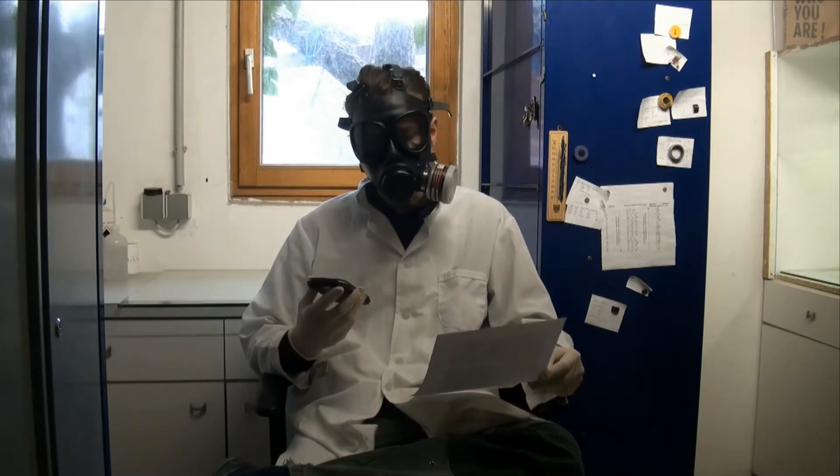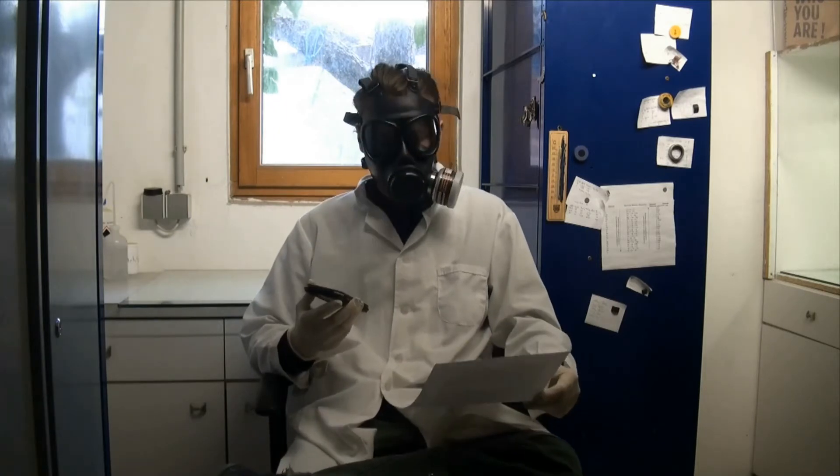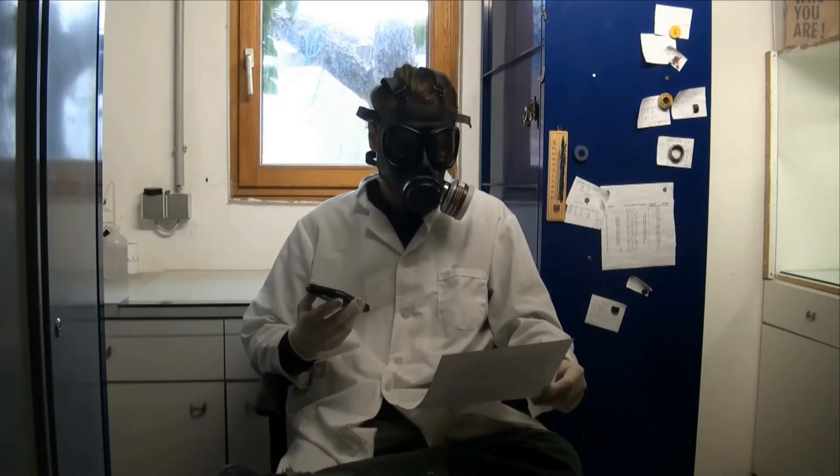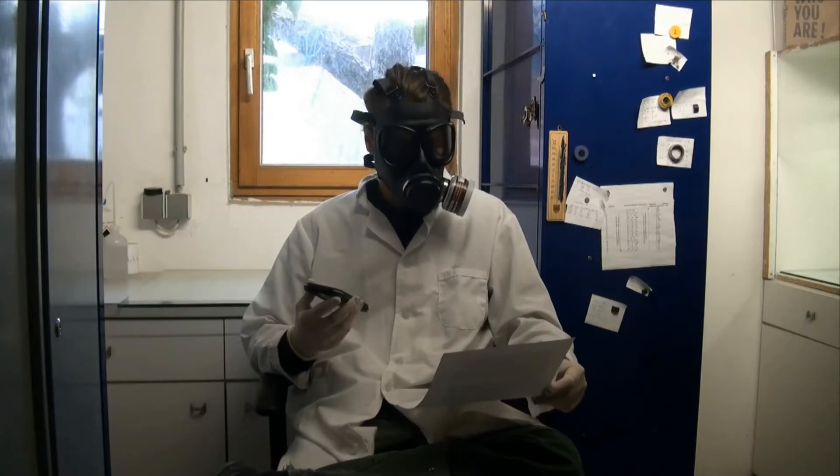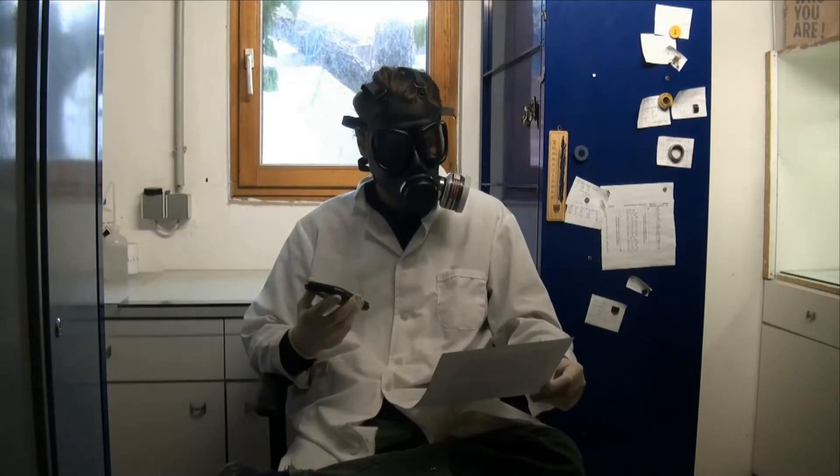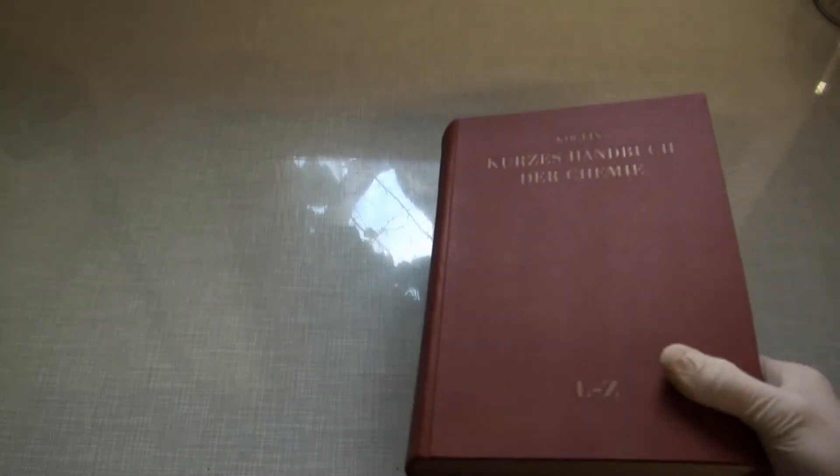because only a small number of reactions really need 100%. I started this experiment by measuring the density of my acid, from which I was able to find out the concentration using this wonderful old book.